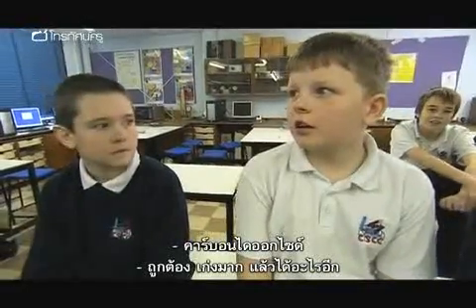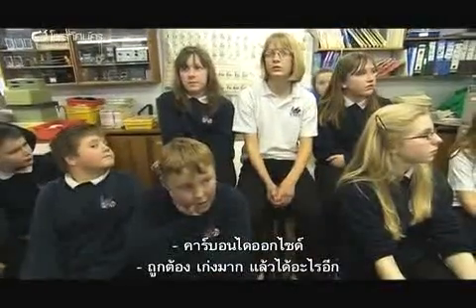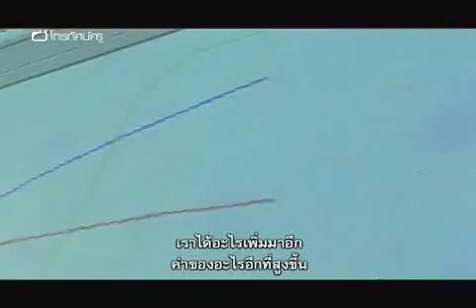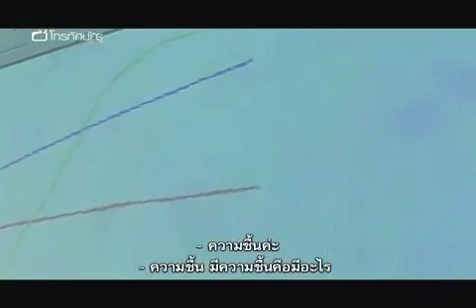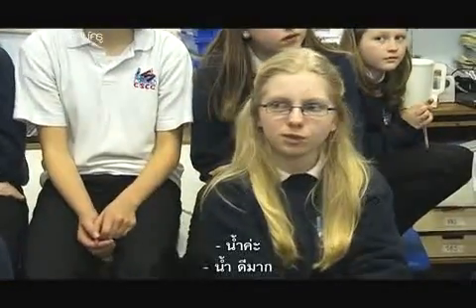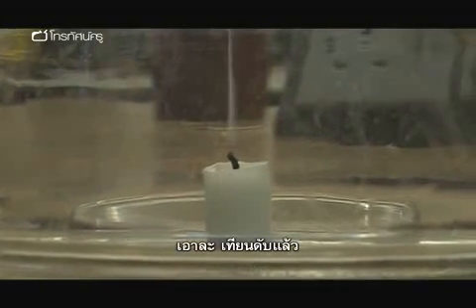What are we producing? Is it carbon dioxide? It is. Well done. And what else are we producing? Think about what's the other one that's gone up? Is it the humidity? And what does the humidity detect? The water. The water. Thank you very much. Okay. I know the candle's gone out.